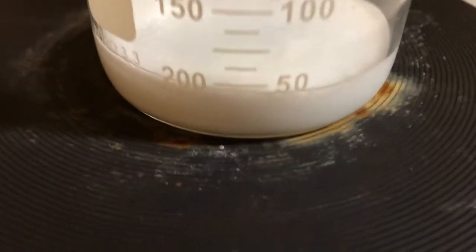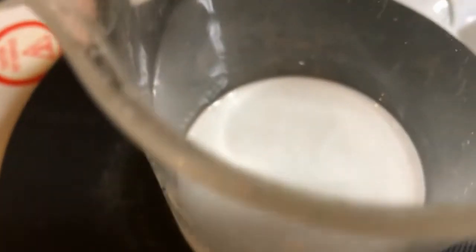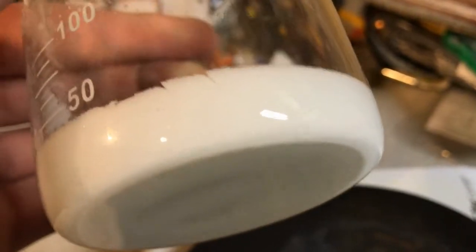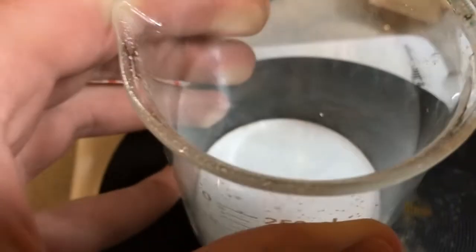And out the precipitate comes — it's very dense and white. It's likely very crude, but we can do a recrystallization. At this point, you don't really have to do a recrystallization, but I'm going to do it anyway — because, why not?